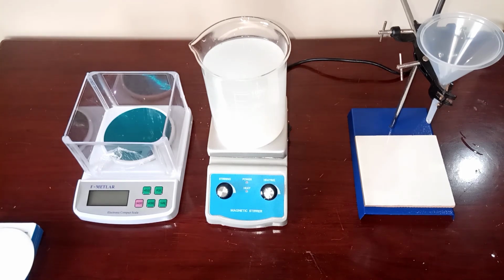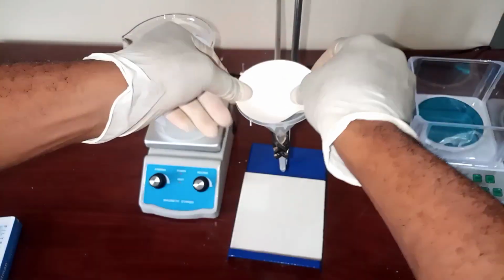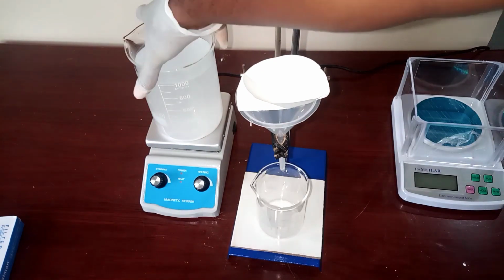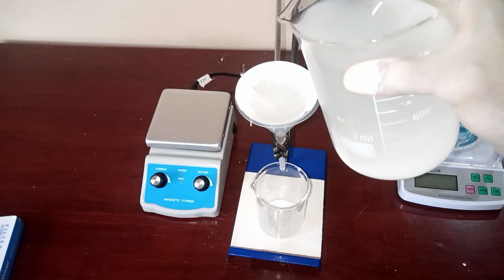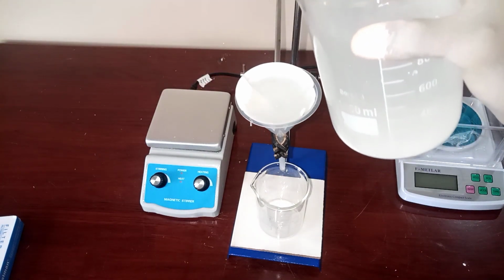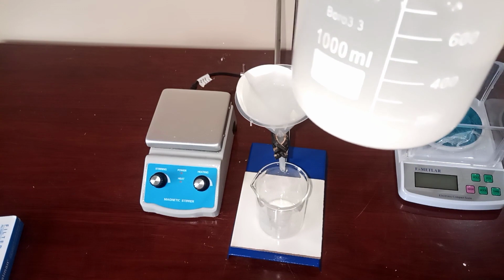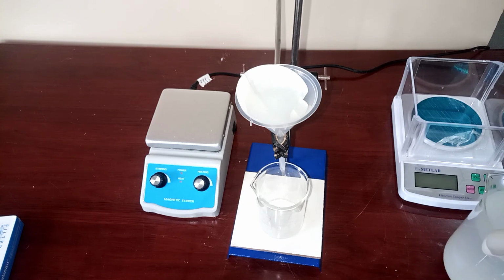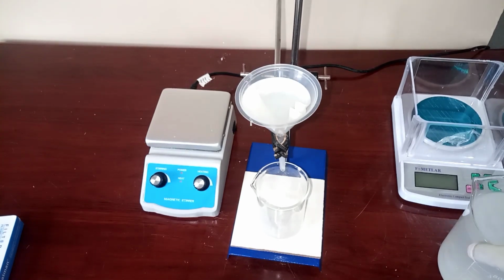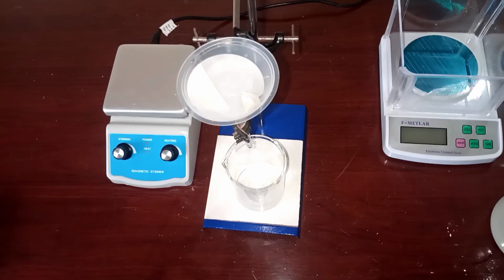If need be, you can filter with a filter paper to get the clear solution. So here's your filter paper. You fold it into 2 and into 4, and a quarter of it you fold into 2. You fit it very well into your funnel, and then you carefully pour out the top of it via the filter paper to get the clear solution, which is your lime water. So you carefully decant the top of it, which is your lime water, through the filter paper.